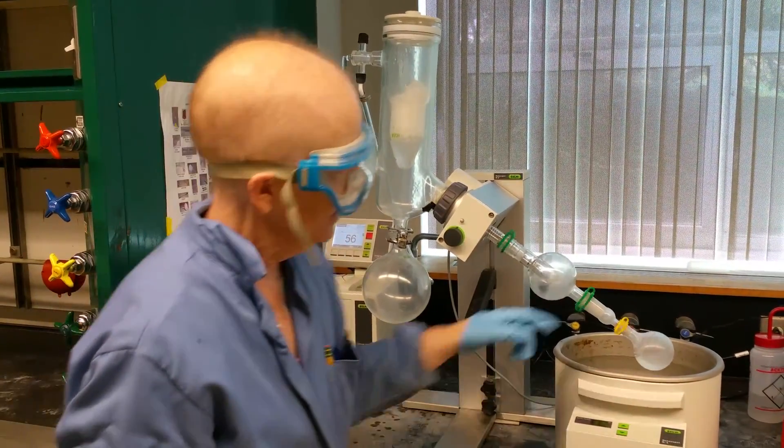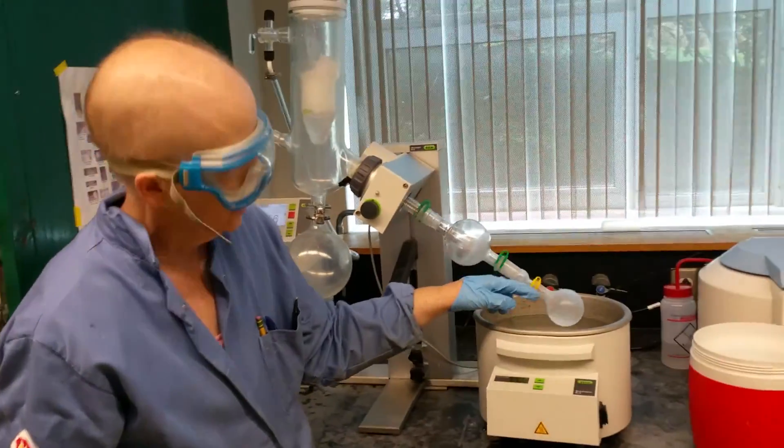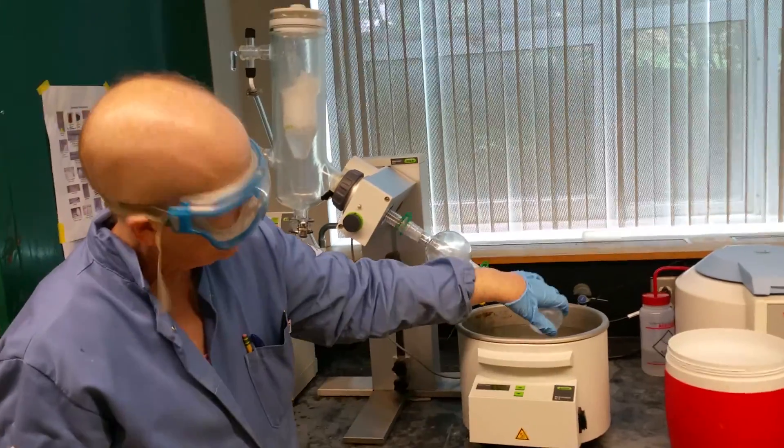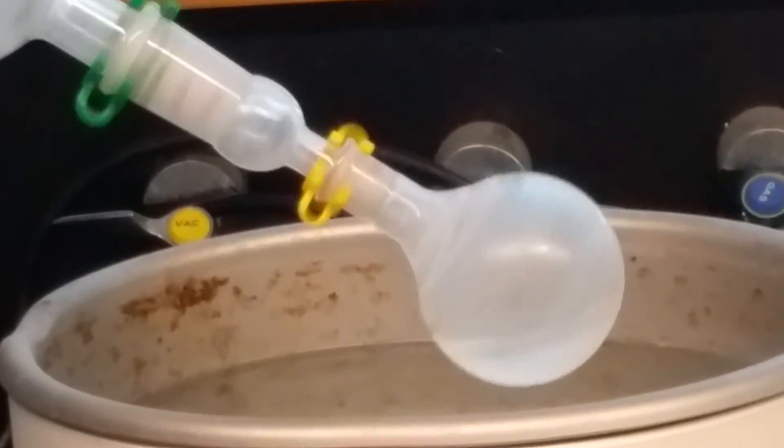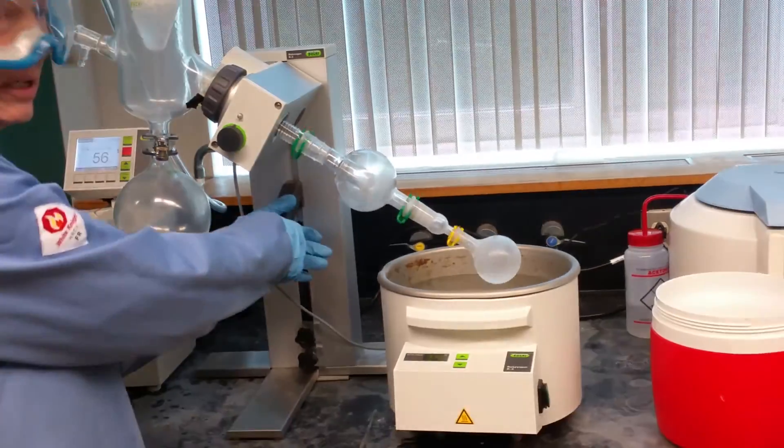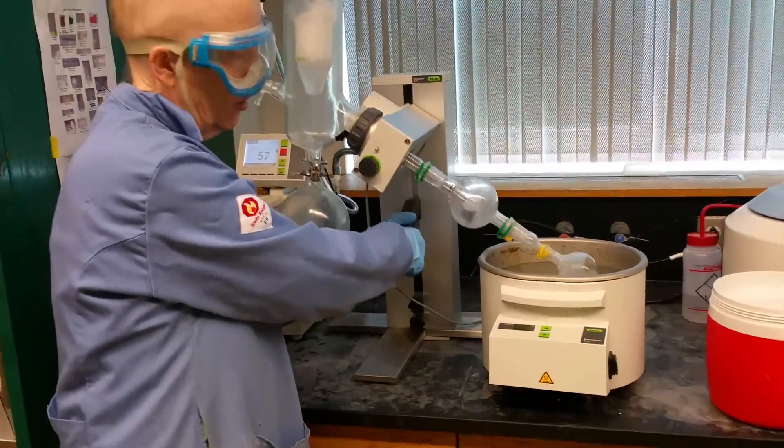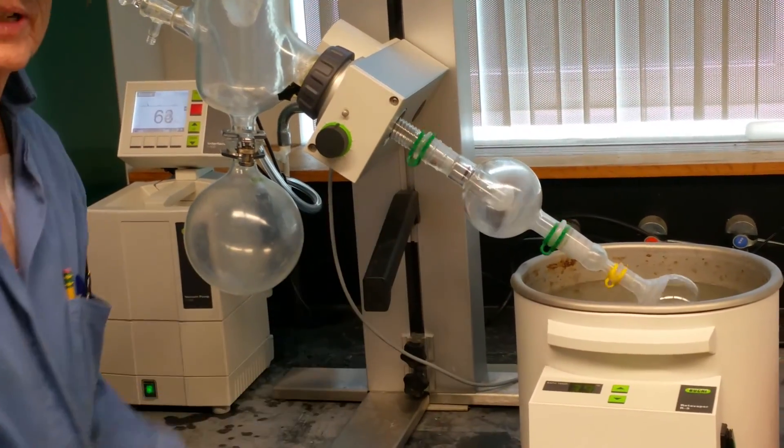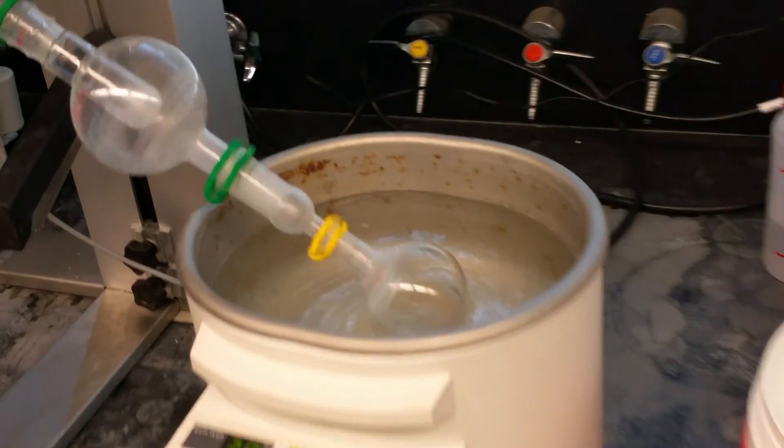So what's the rotation for? The rotation increases the surface area and it causes the vapor to lift off at a higher rate. The idea is it's becoming a vapor, it's going through this tube, it's coming up here, it's hitting this cold finger that's filled with either dry ice or water ice and then it's dripping in. Now initially we had a little drip. But what's happened here because evaporation is endothermic is that this has actually gotten very cold. There's actually ice on this flask.